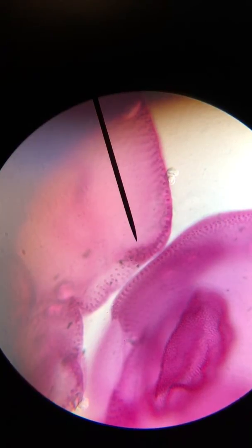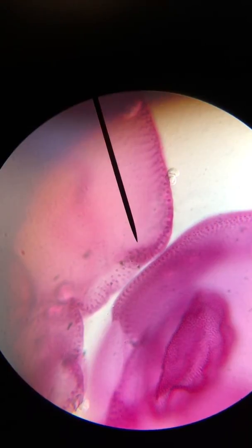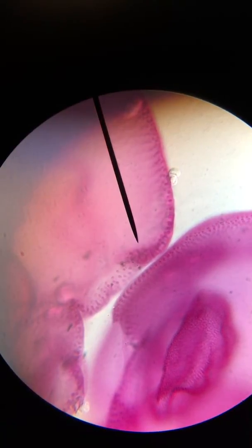In fact, I think here you can see the 2 edges of these larger mother colonies, and if you see those little dots along the perimeter, each one of those is actually an individual Volvox cell. And if you're asking, I can't see those 2 flagella, well, you probably can't, because they're pretty transparent and difficult to see. But when you see the living ones, you will see the effects of their motion in the water, and that's kind of fun. All right, I'm going to stop this here and give you a separate clip showing you 1000 magnification.